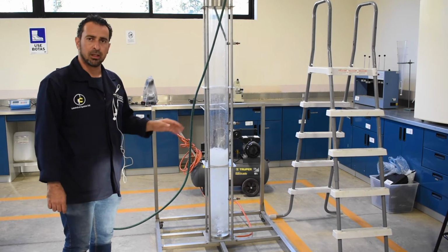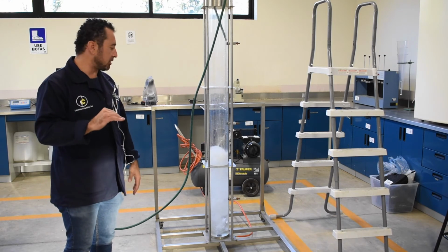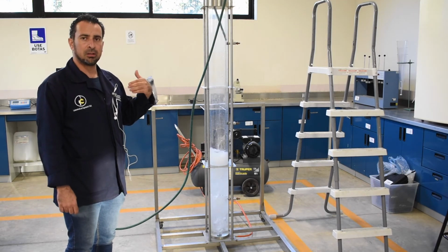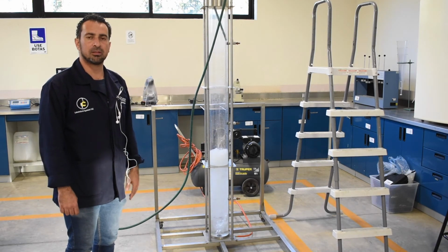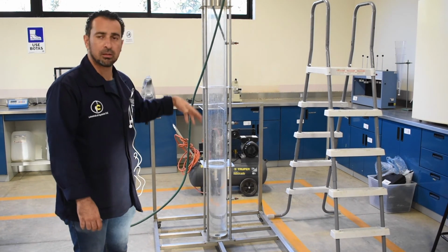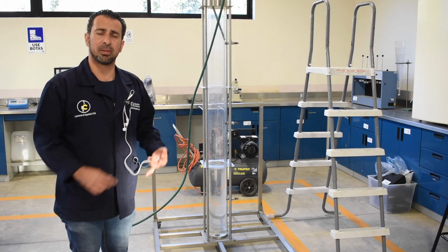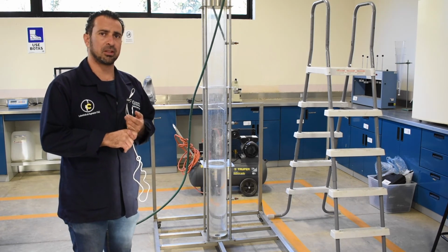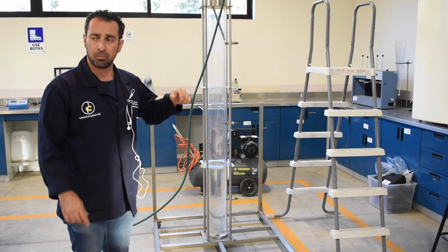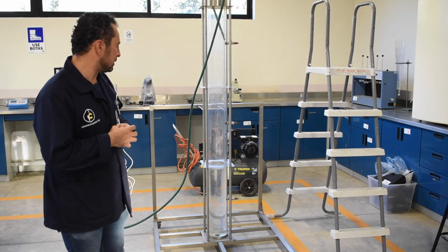Once the 10 minutes are done, you're going to close the valve and let the particles sit, so you can start measuring at time 0 for each of the ports, and then at 5, 15, 30, and 60 minutes respectively. Once the column is in repose and time is passing, take samples of all the ports. Make sure you take physical and chemical parameters of each of the ports. Also, make sure you work your total solids and suspended solids.